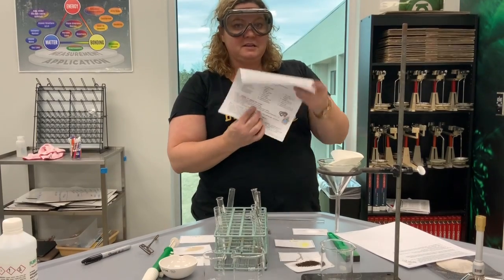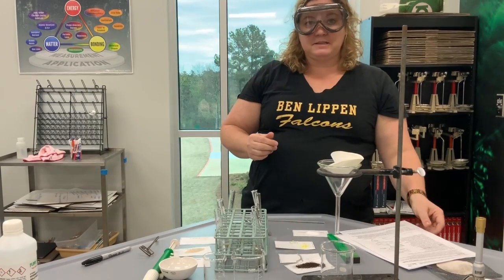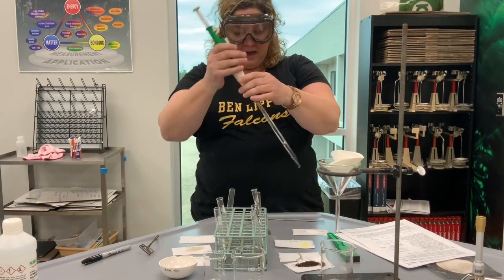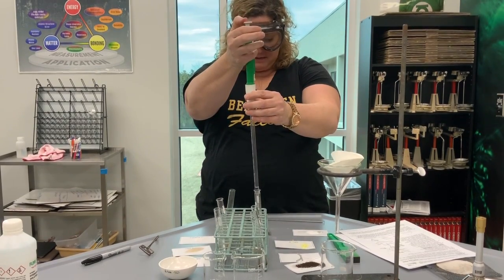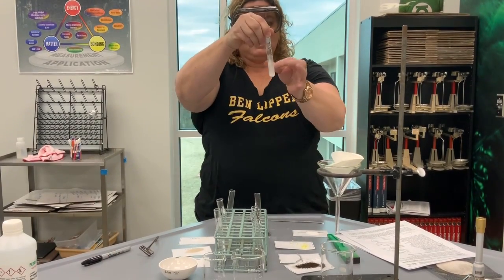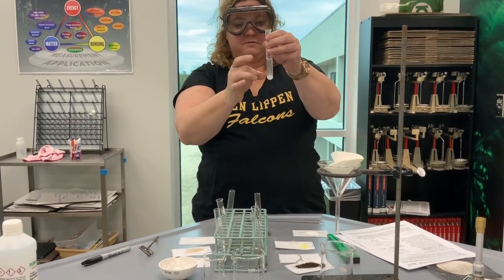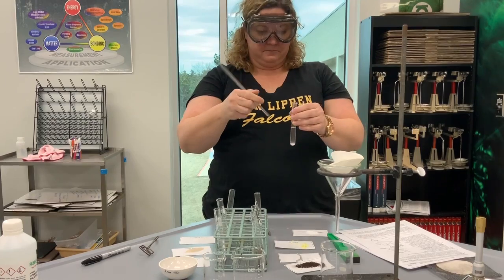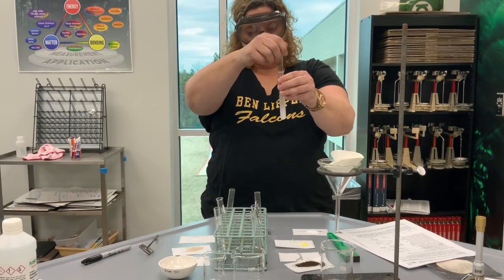I am still in part A, but I have moved on to parts 4 and 5, so I'm testing the solubility of each one of these chemicals. So I have in here my distilled water, and I'm adding my distilled water to the sodium bicarbonate solution. And this is what we call a flick test. So where you just flick the bottom, so you're kind of stirring it, and you can flick it to do it. The other thing you can use is a stir rod to try and stir it to see if it is soluble.